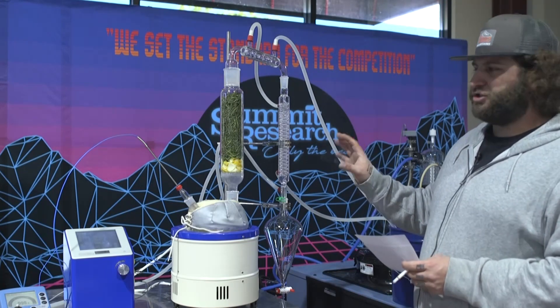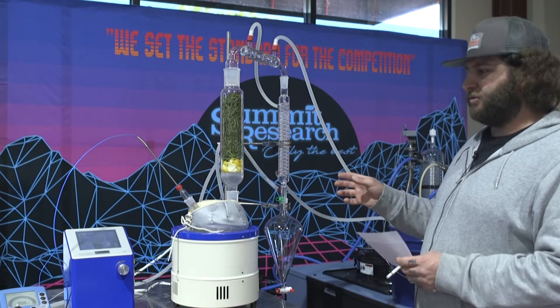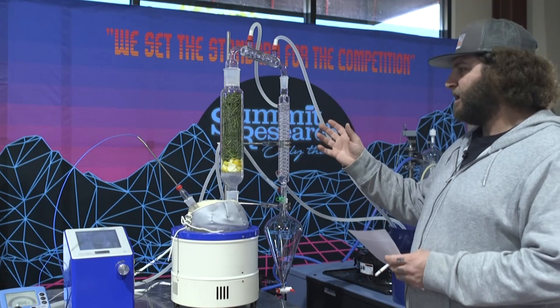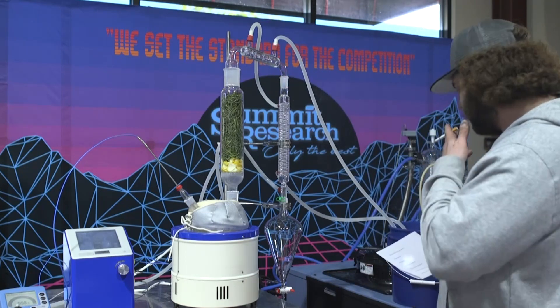Most of what we're doing here is just a general evaporation. If you want to go any further you have to use different types of terpene extraction devices to create analytical terpenes — this will just give you a general result. In some cases people will run it until they see the water coming out. So we're going to get it going here and get started.